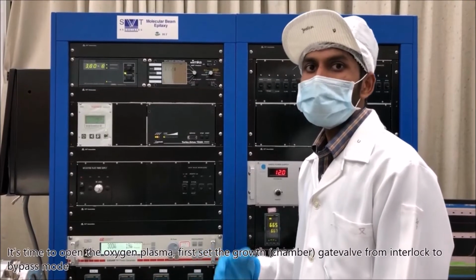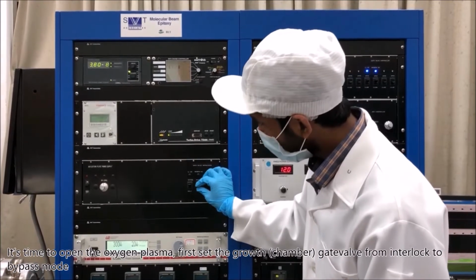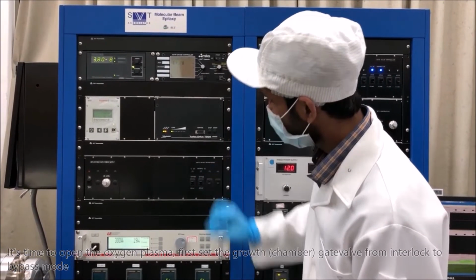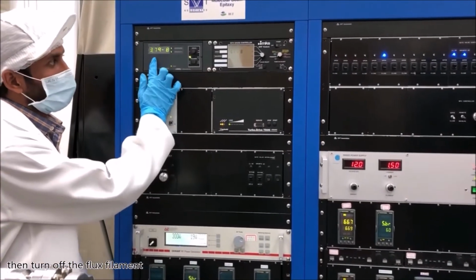It's time to open the oxygen plasma. First, set the growth gate valve from interlock to bypass mode. Then turn off the flux filament.